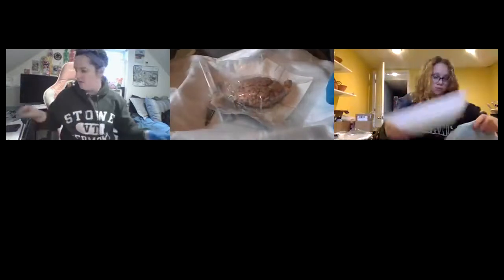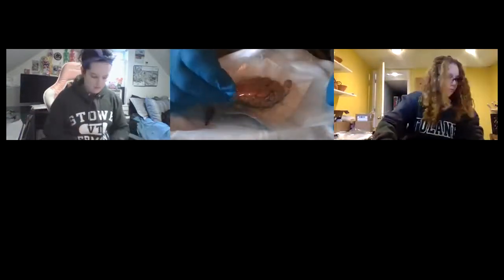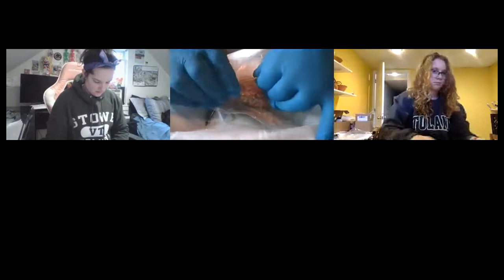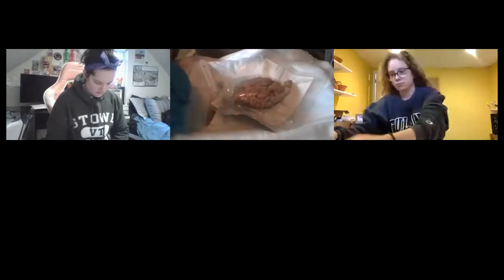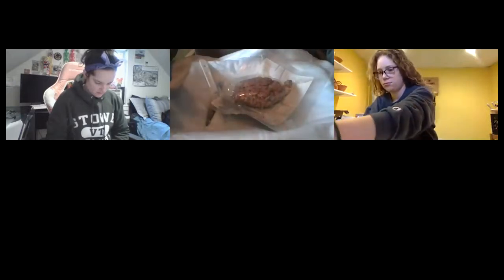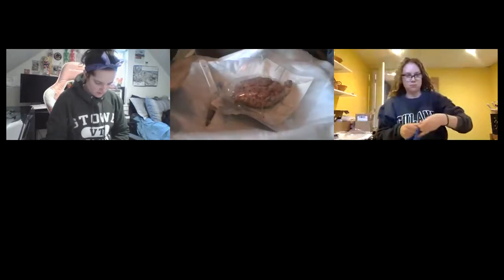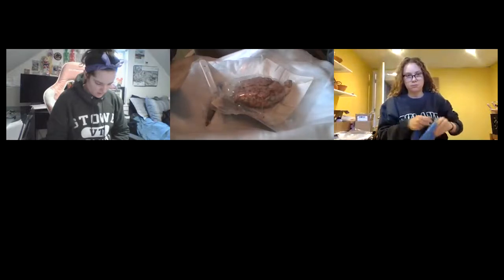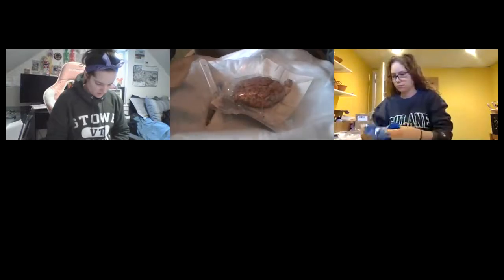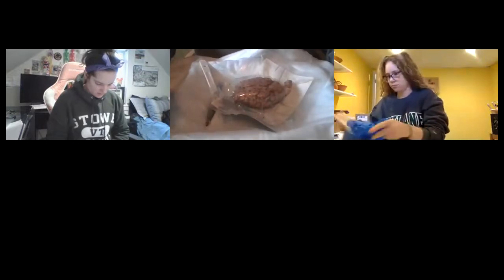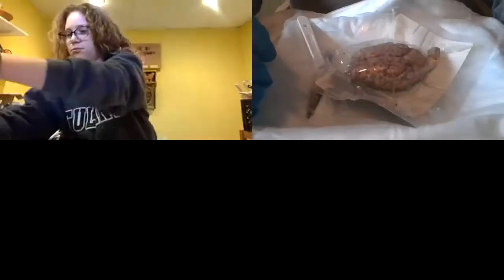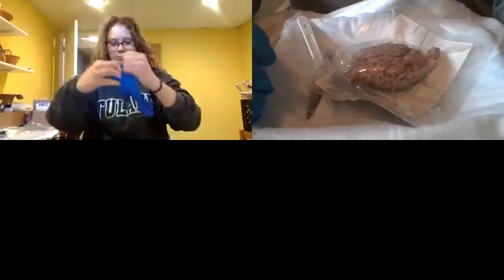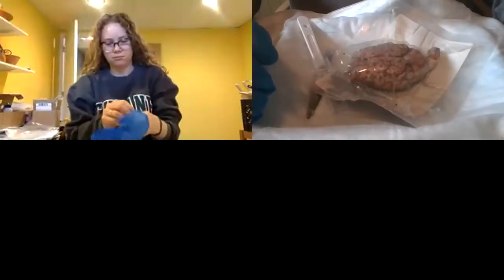Save the tools. I got some toothpicks too that you might want to use to point things out. You should have some alcohol to clean up later. Always wear gloves. And you should wear protective eyewear. Not so bad for the sheep brain, but the chemicals are strong. They could burn your corneas, especially if you get too close. You can wear a mask if that helps you too.